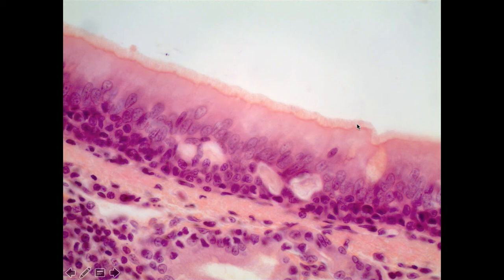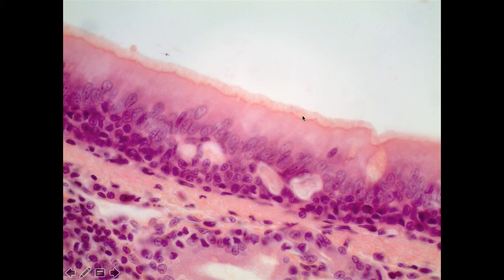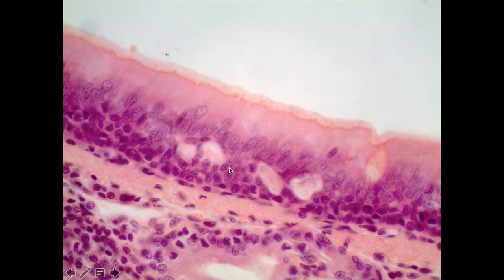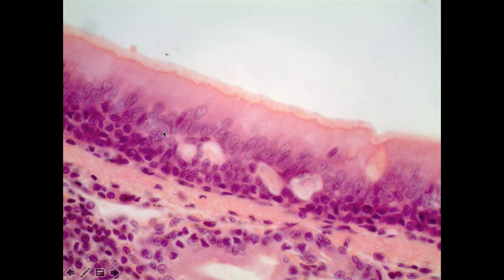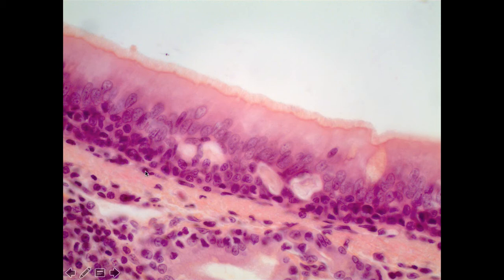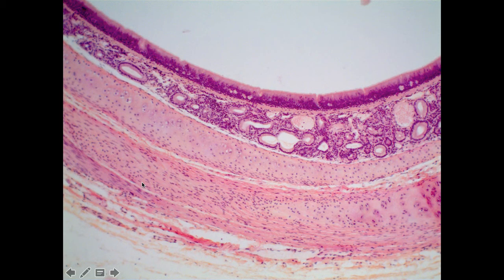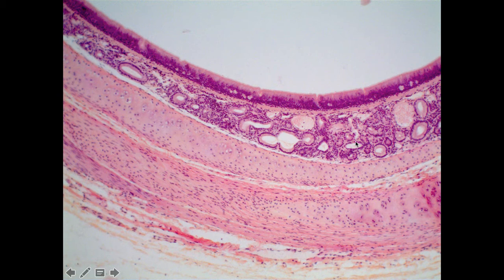The idea of the mucus is to help trap dust and other foreign particles, and the cilia are able to move that up the trachea and into our throat. This is that very classic pseudo-stratified look — all of these cells share a basement membrane, but some have very short extensions. The nuclei appear to be stratified, but in fact are all one continuous simple layer. Below the pseudo-stratified layer is the submucosa, where we can often see really prominent tracheal glands.